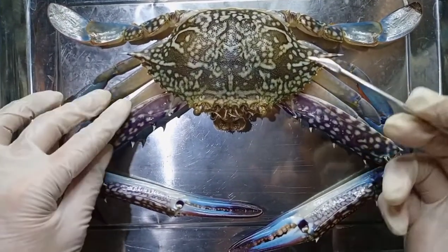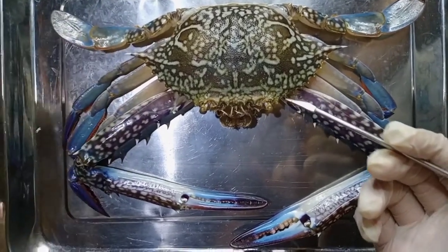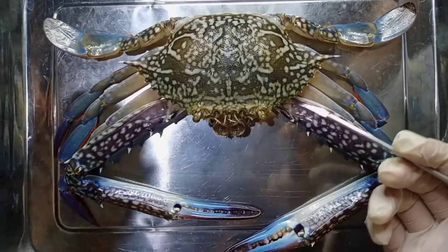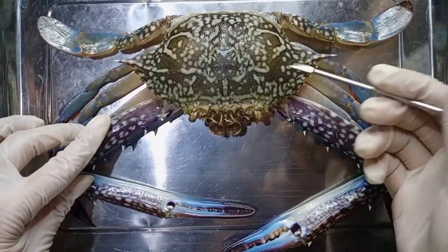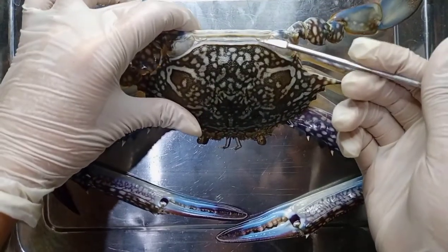I read a study conducted by Fish Source 2020 about the characteristics of a swimming crab. Let's see if it meets the three characteristics. First, the carapace should be flat and broad. As we can see, the carapace is broad; however, it's not quite flat.